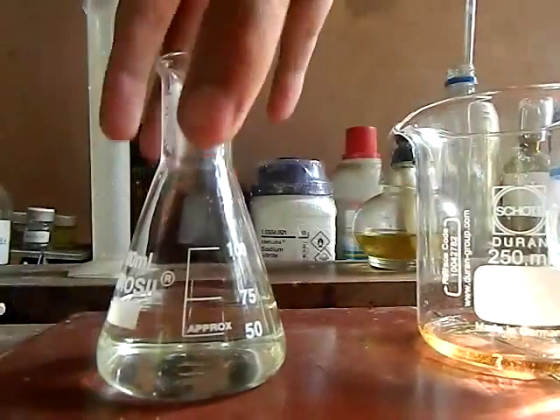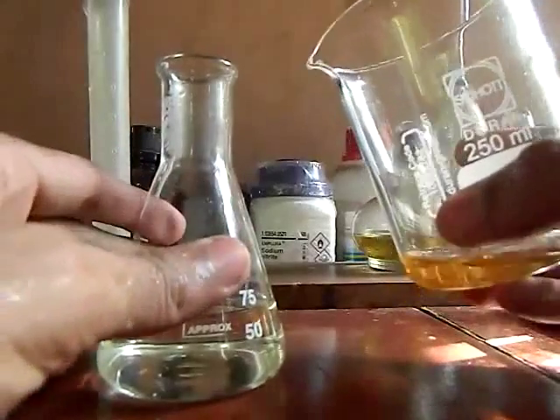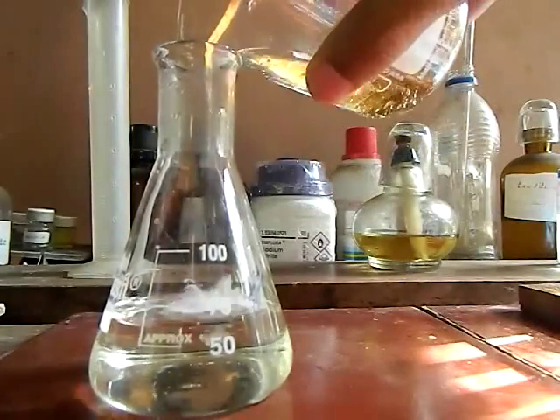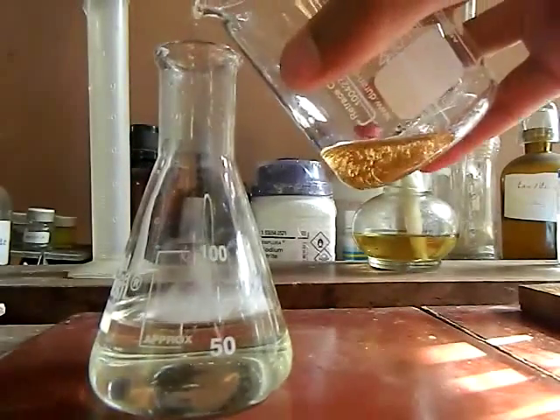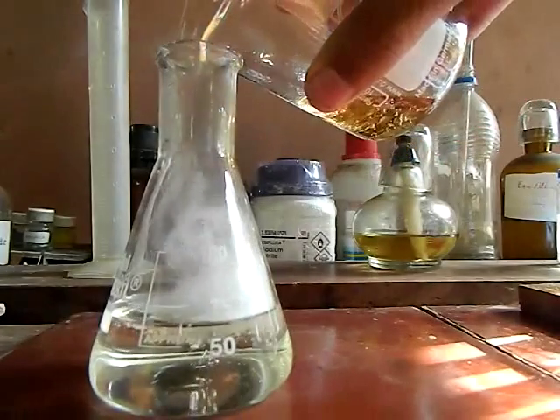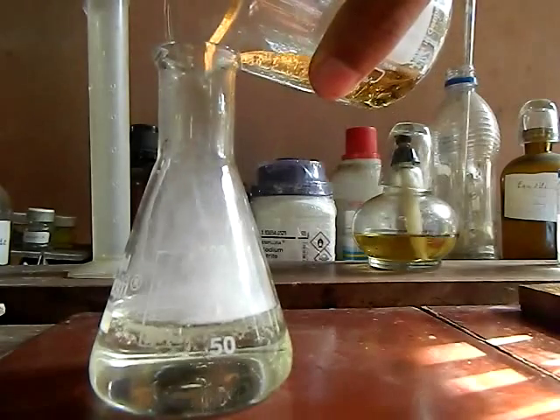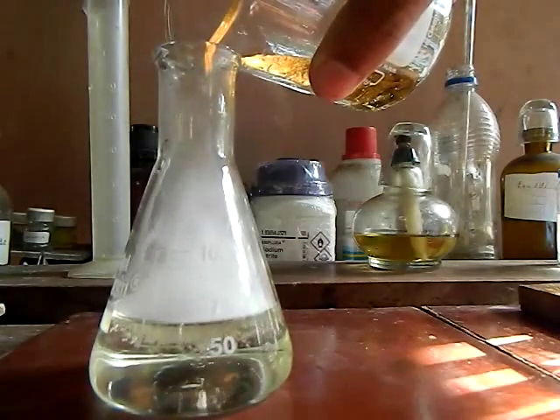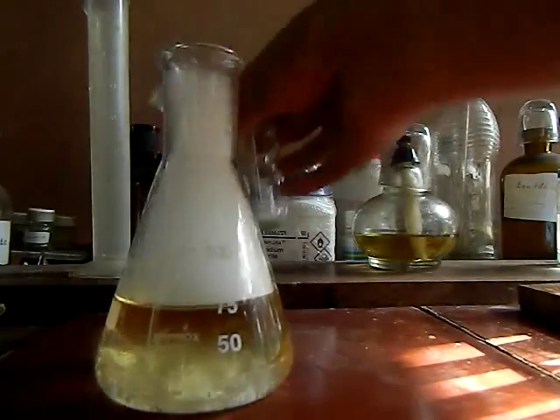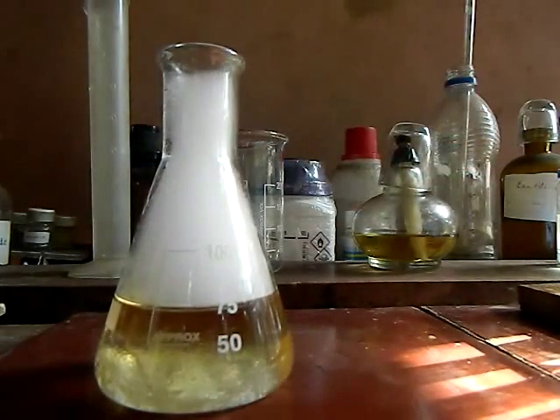We pour the 10 ml of aniline into the concentrated hydrochloric acid. Care must be taken — this is a very exothermic reaction and a lot of heat is liberated, so we have to pour the aniline into the acid very slowly.